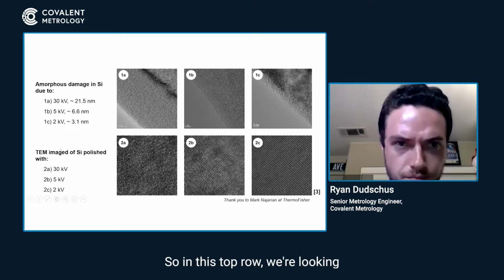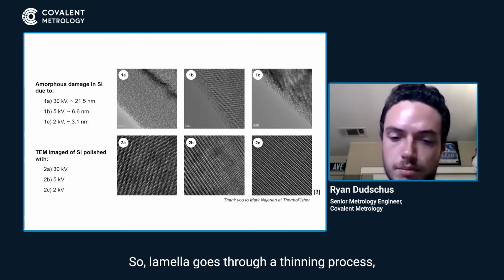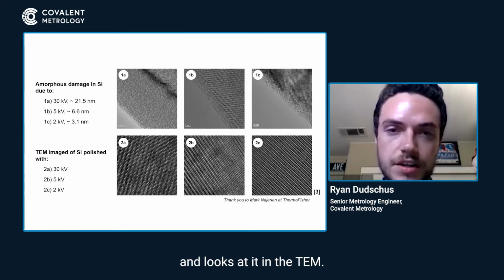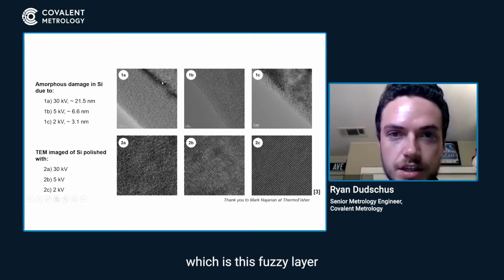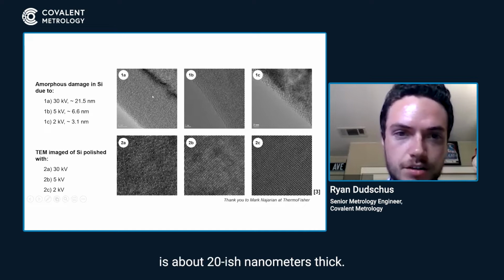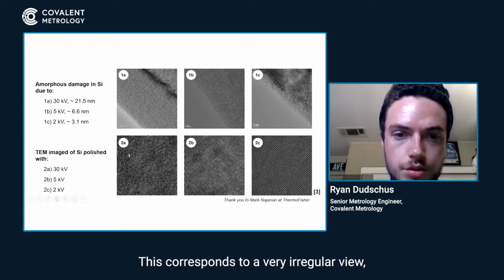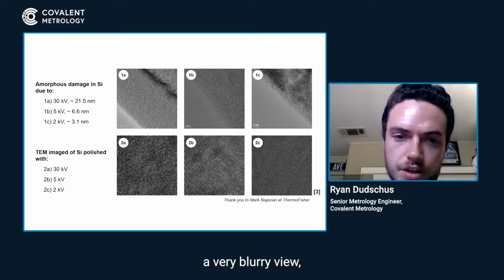So in this top row, we're looking at a cross-sectional view of the lamella. The lamella goes through a thinning process, and then someone takes a cross-section of that and looks at it in the TEM. So in 1A, you're looking at amorphous layer damage, which is this fuzzy layer caused by a 30 kV gallium ion beam. You can see that this thickness is about 20-ish nanometers thick. And this corresponds to a very irregular, very blurry view.